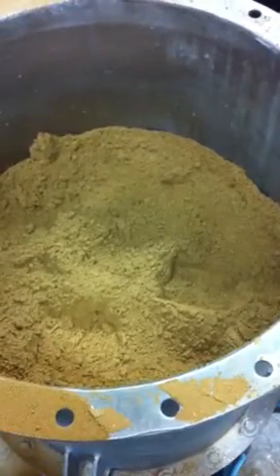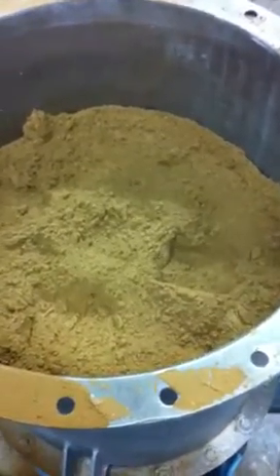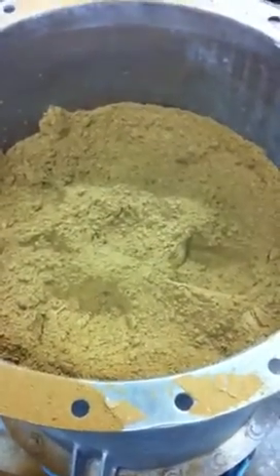The material is starting to rise — actually pushing the head of material up. It's starting to percolate a little bit. I'd say once we open this valve it's going to flow.